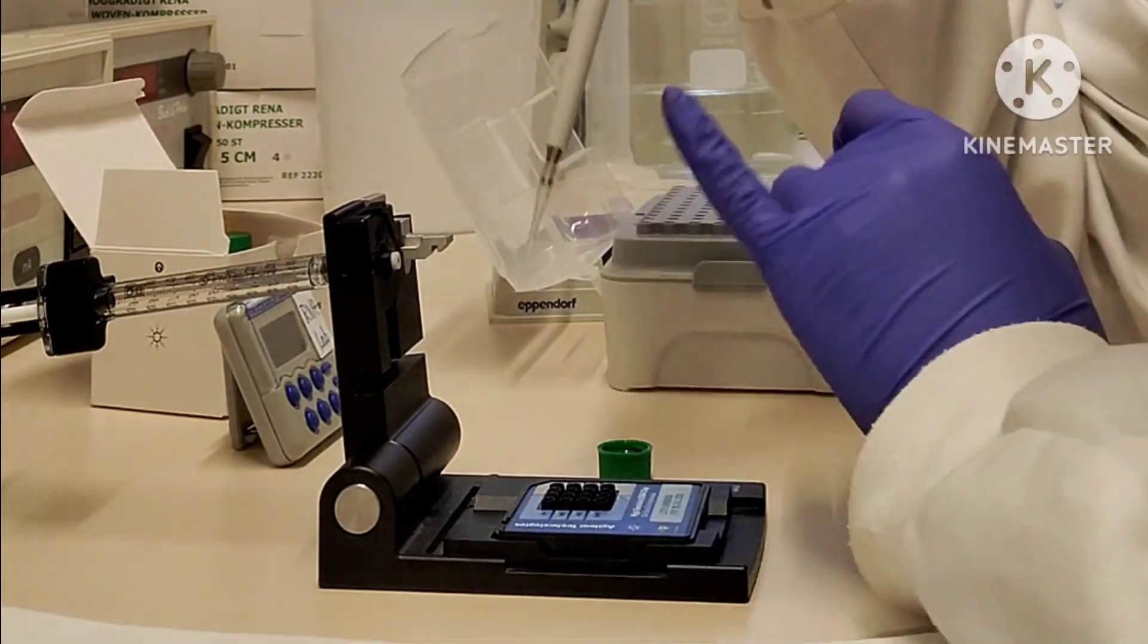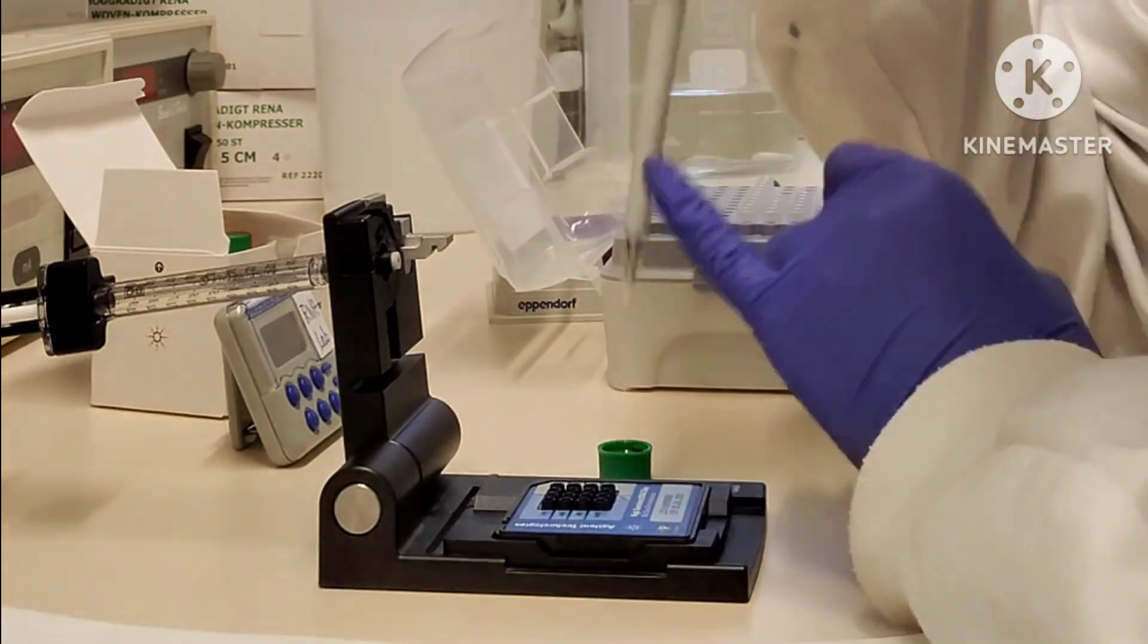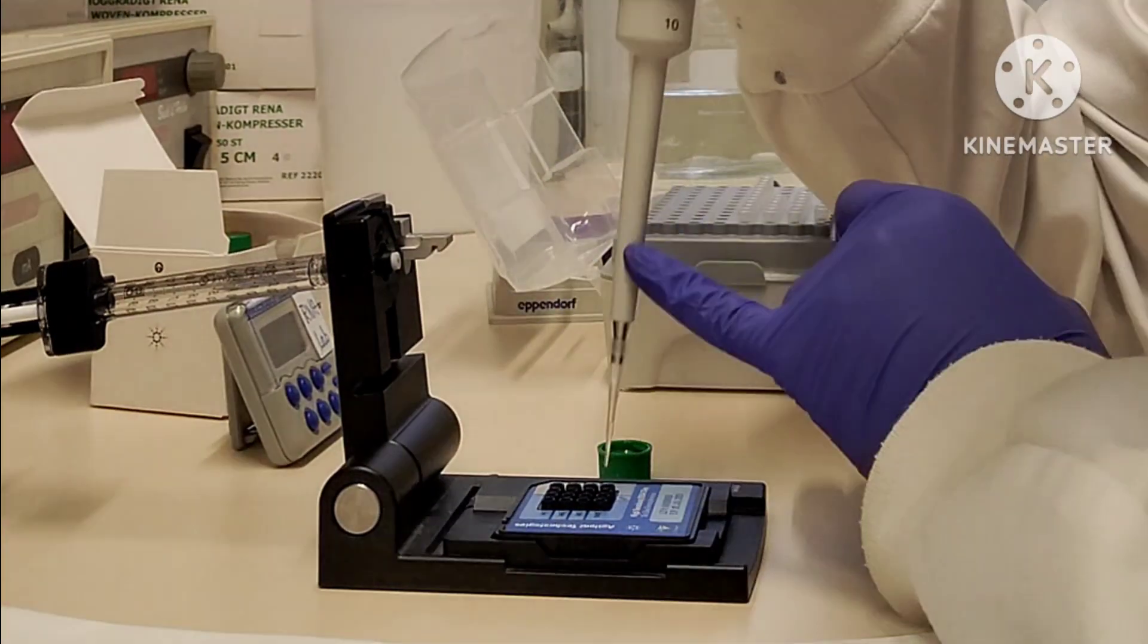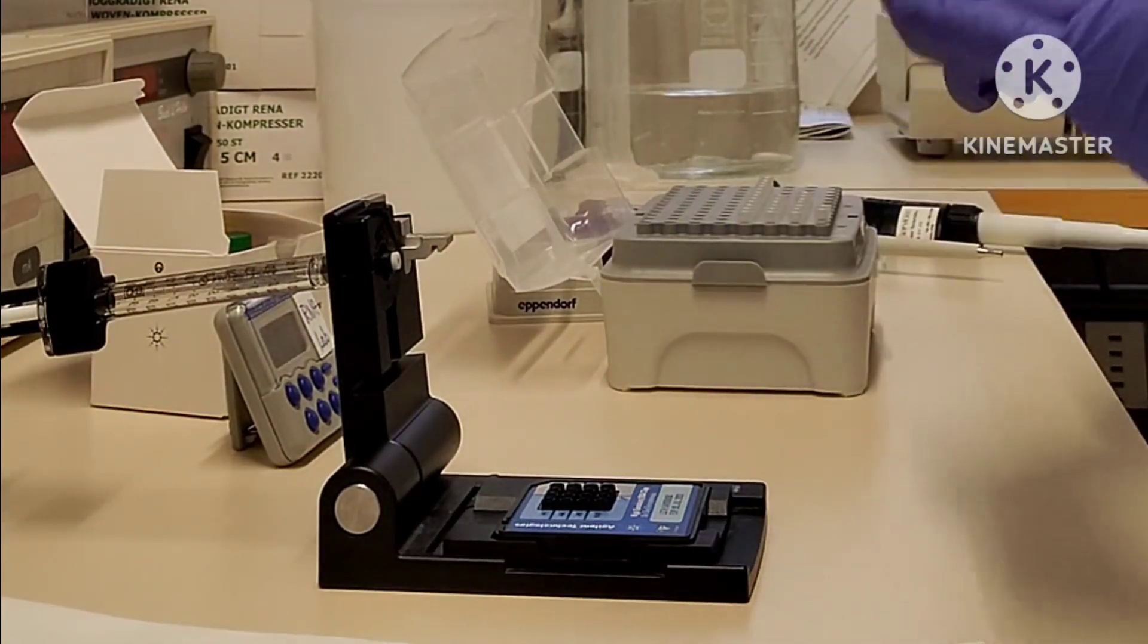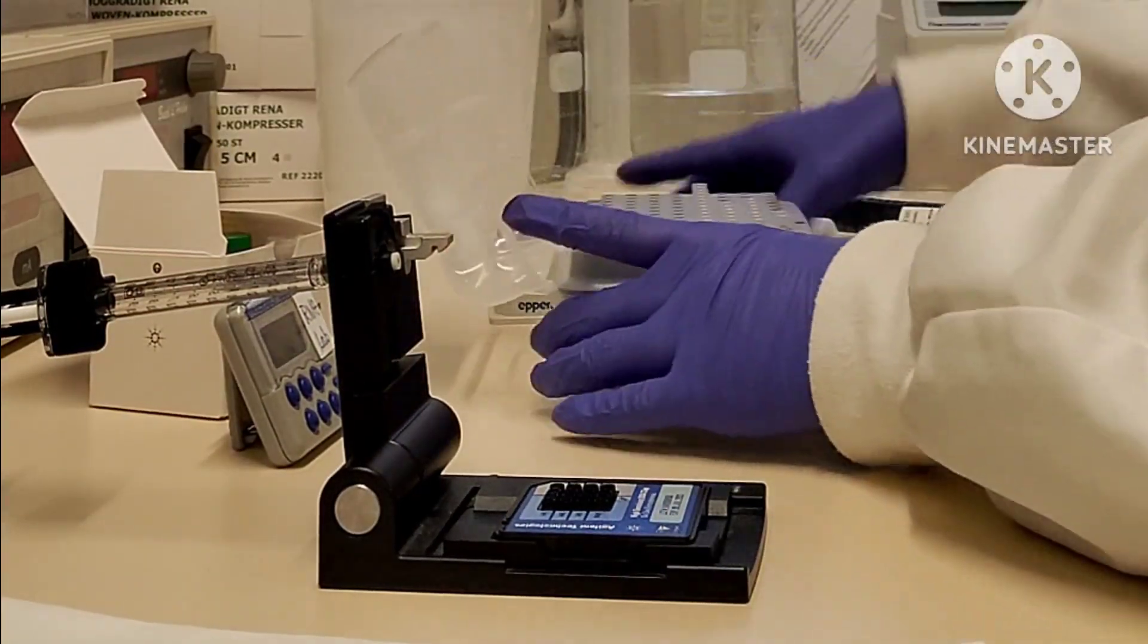Like I told you previously, just avoid bubbles because it's gonna be difficult for you later. Try to pipette nicely so you can avoid bubbles, and if by chance you add a bubble, just break them from the pipette tip—it's quite easy.